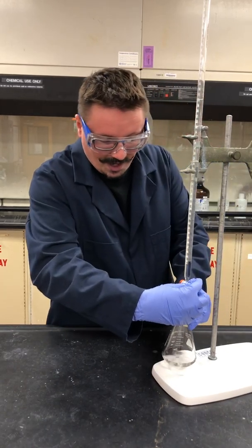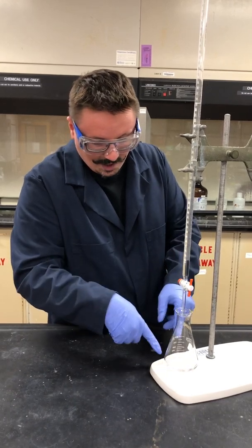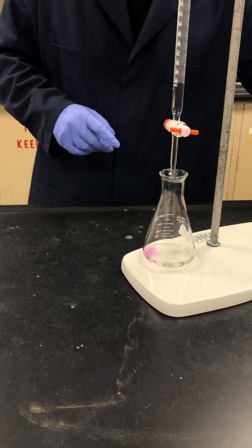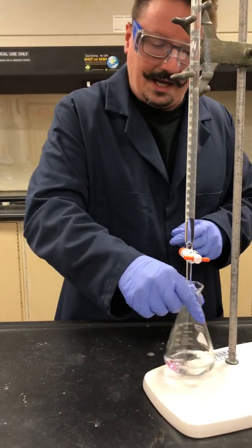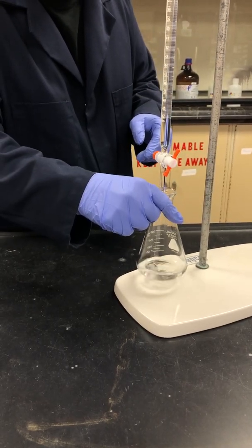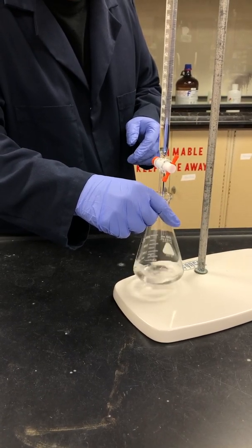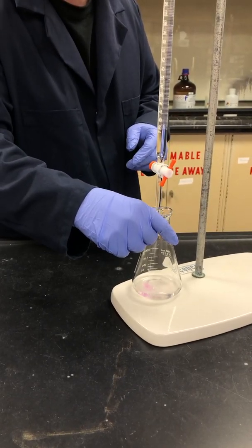So maybe you'll notice as I start to add that base — and of course now my burette stops working, there we go — you'll see that pink starting to appear in there. That's the color of that indicator. This indicator has two forms: a protonated form and a basic form. One is clear and the other is pink. As we get closer to the unprotonated, basic form, we're going to get that pink color. So I want to add this until I can barely see any of that pink color at all, and that's going to take us to what we call the end point.